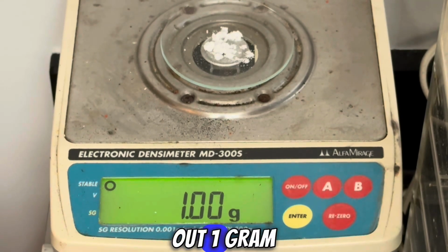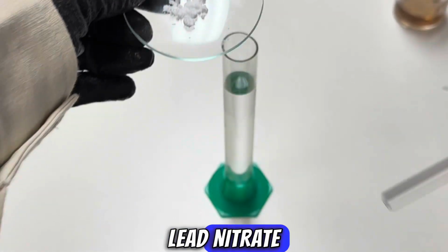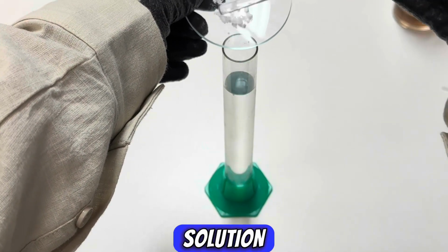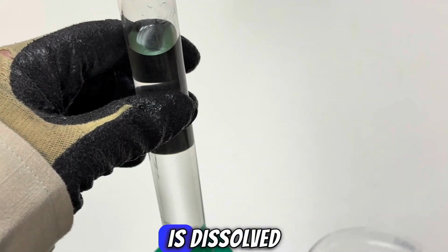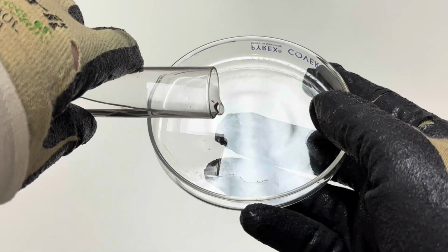Begin by measuring out 1 gram of lead nitrate. Add your lead nitrate to 50 milliliters of distilled water and stir your solution until it's aqueous. Once your lead nitrate is dissolved in the solution, add a little bit to a petri dish. Okay, and now you're ready for the best part.